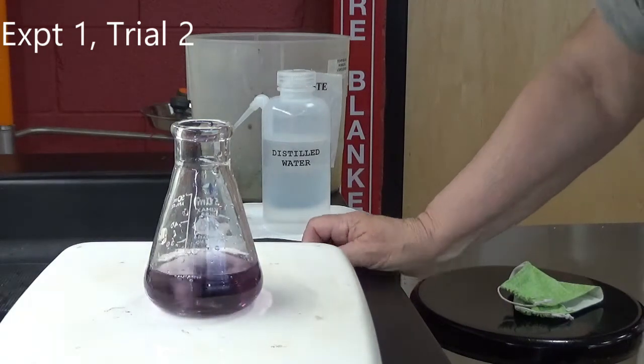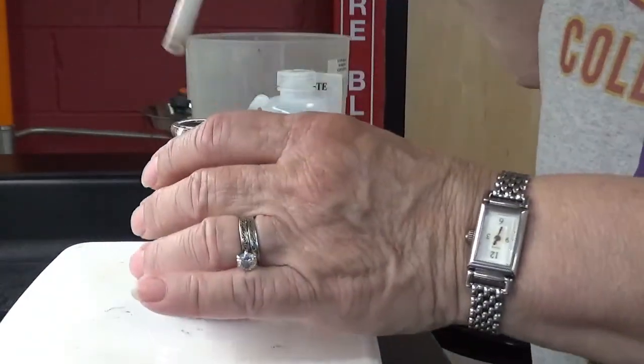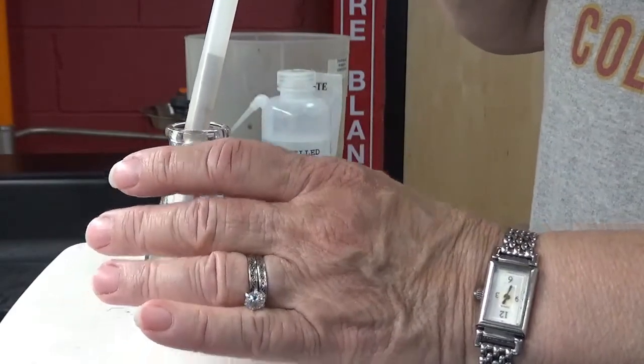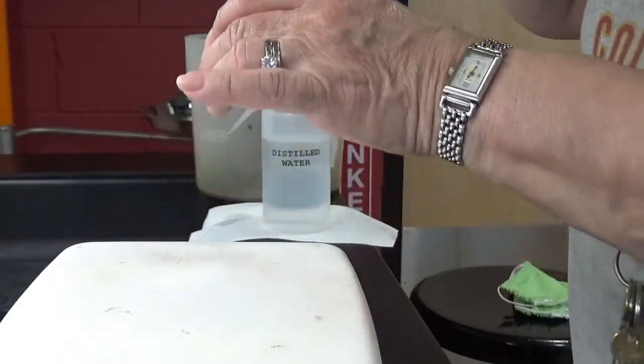There we go. We'll try it again. This time we got 32.74. All right, well, quite a bit different here.